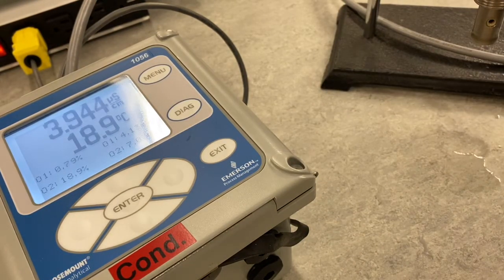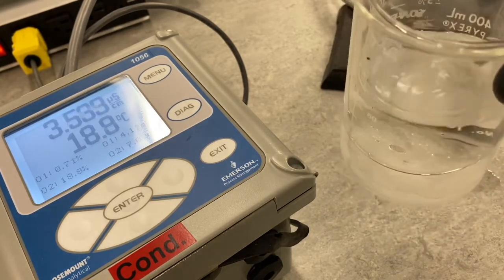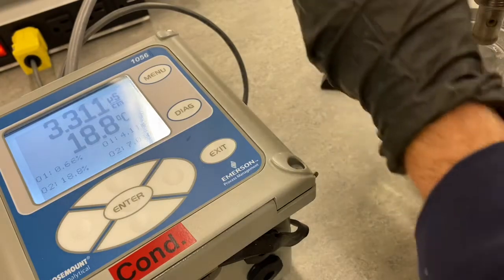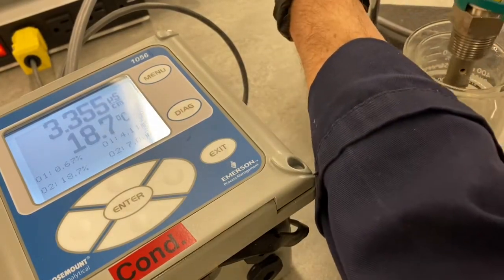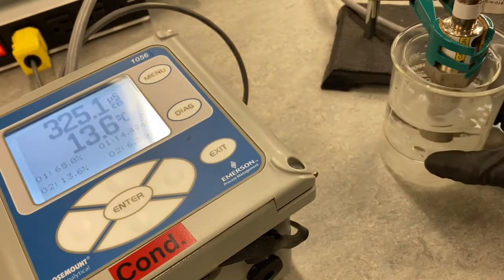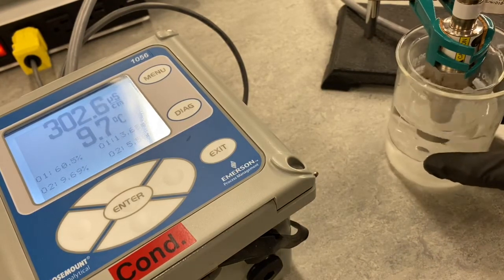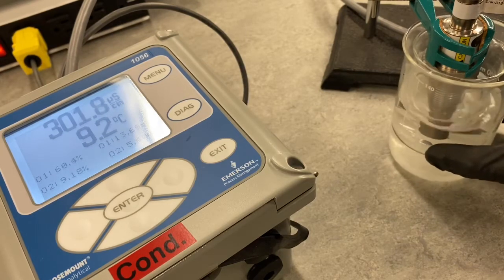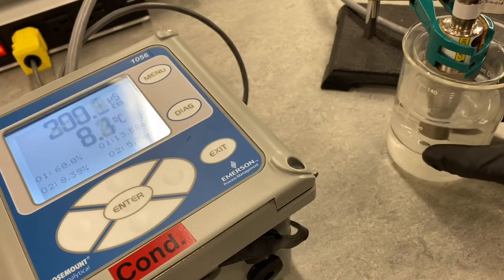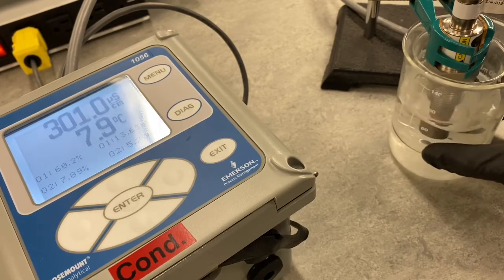And then now I have some tap water over here. Notice how I've put it in an ice bath, but I separated the two just so our ice didn't interfere with our conductivity measurement. But this water came from the exact same location. It's just at a different temperature. So let's see. I'm going to drop this in. It should be colder. And it looks like we're getting a colder value, around 9 degrees. Just let this stabilize. About 300 microsiemens, right about 300, 301.